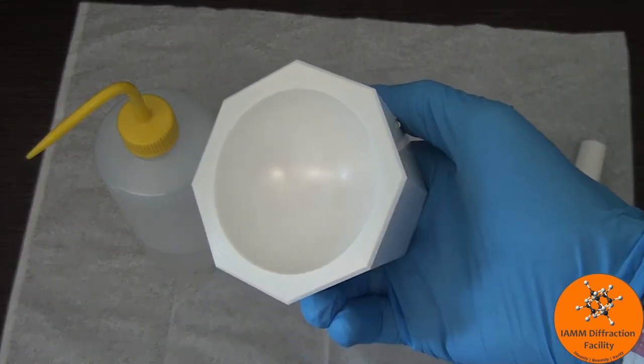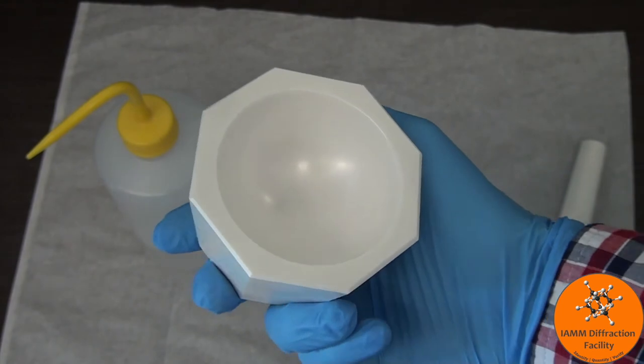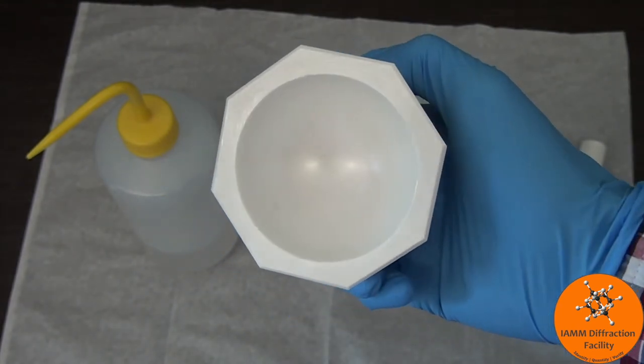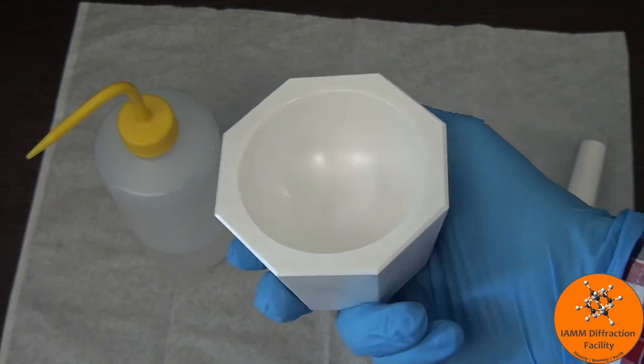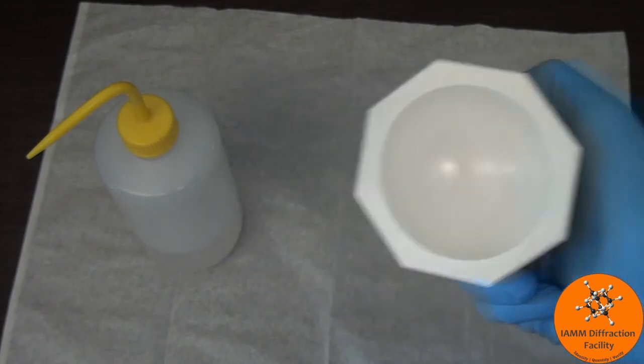This is after my next cleaning. So it might be a little tough to see, but there's still a little bit of marks in there, but it's looking a lot better. So let me try that one more time.